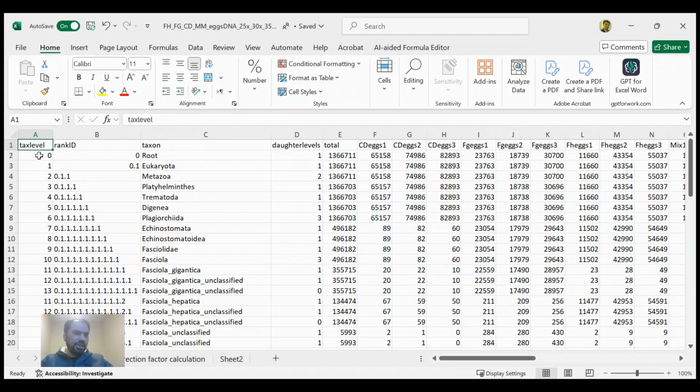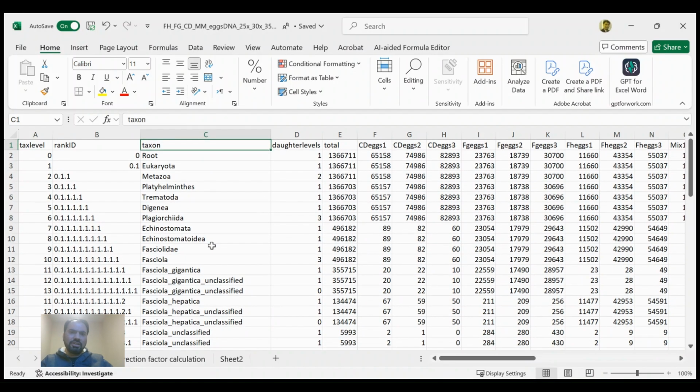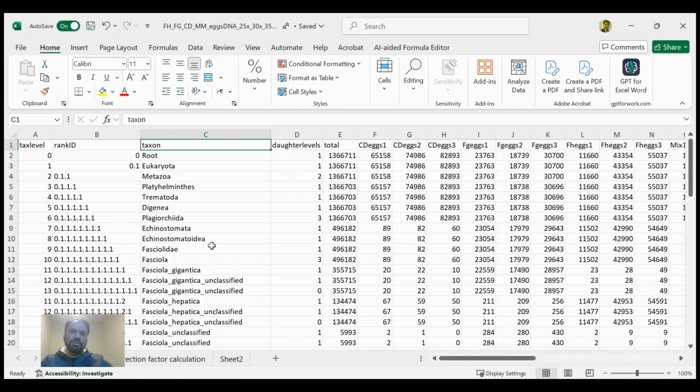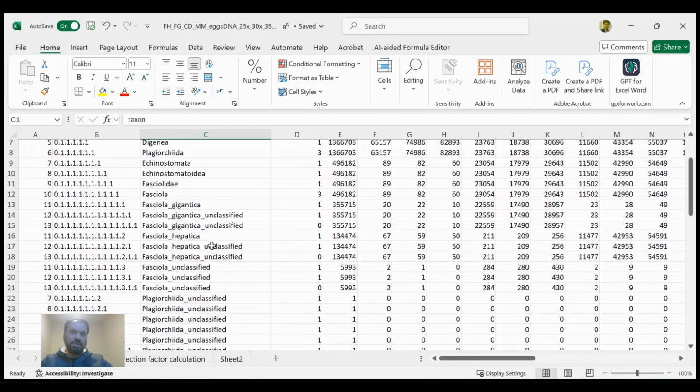In this file, you can see the first column is showing the taxon level, and then the rank ID with the speciation of your data, and then the taxon level of your species. So it depends on what your experiment is. I am working on Fasciola hepatica, Fasciola gigantica, and Calicophoron daubneyi. So speciation is showing like that. If you are working with a microbiome, it will look different, as per the output of your data.